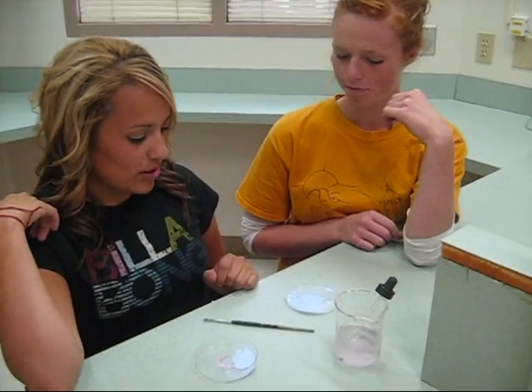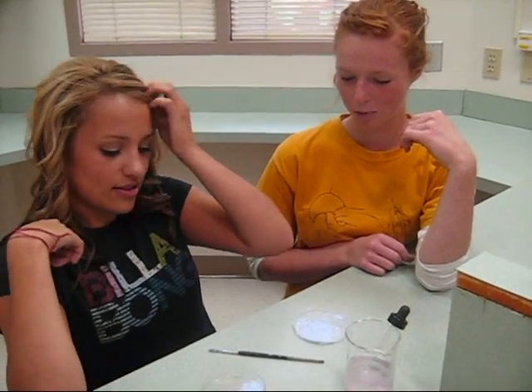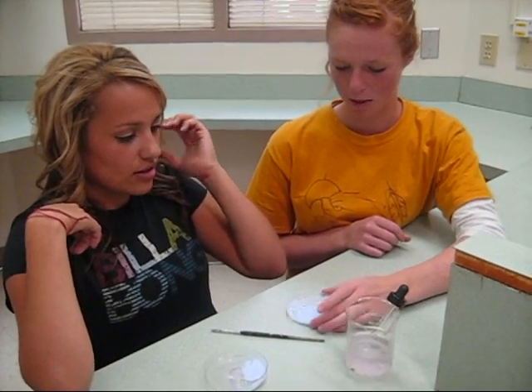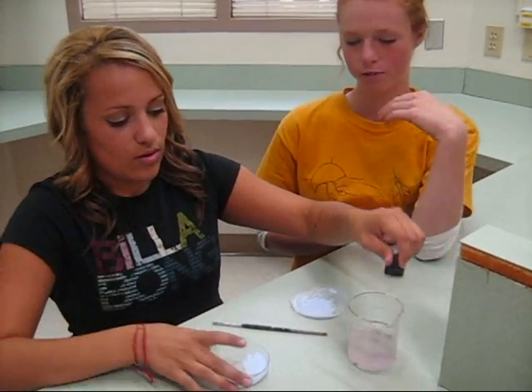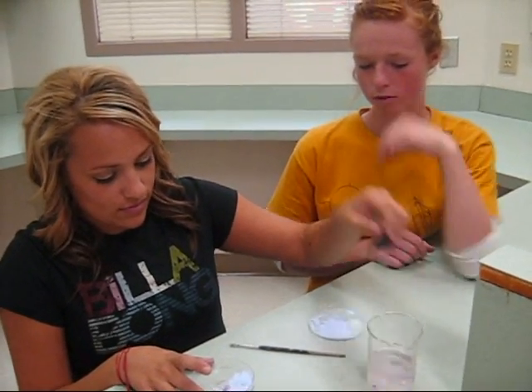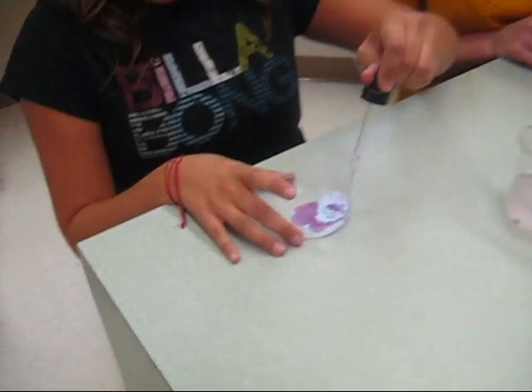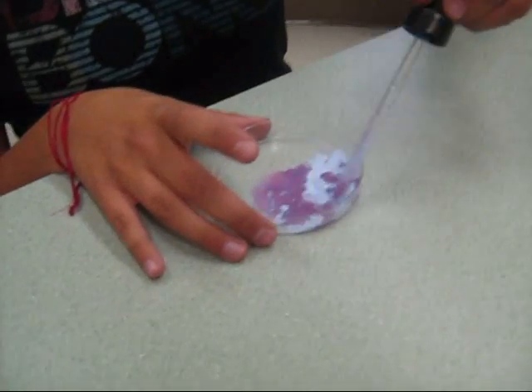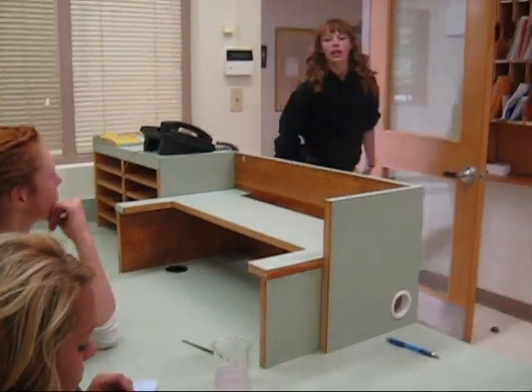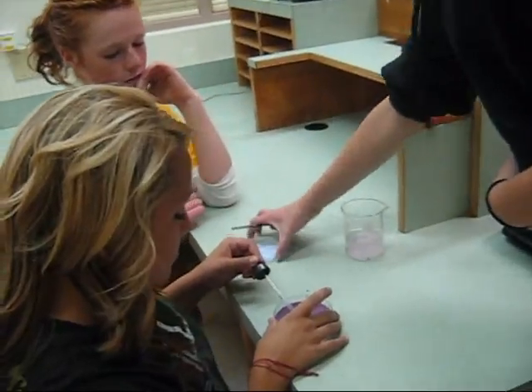Do you remember which one's her makeup and which one's the chemical? No, but I think this one might be her. Okay. Hold on, guys. Hey. Guys, you done? Yeah. Okay, well, I'm gonna go finish putting on my makeup then.